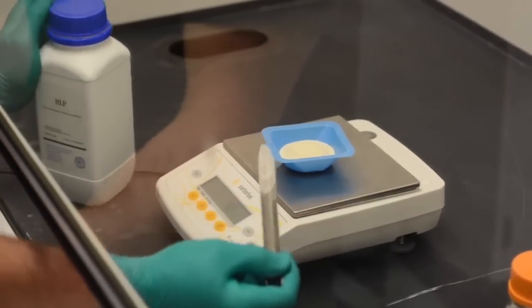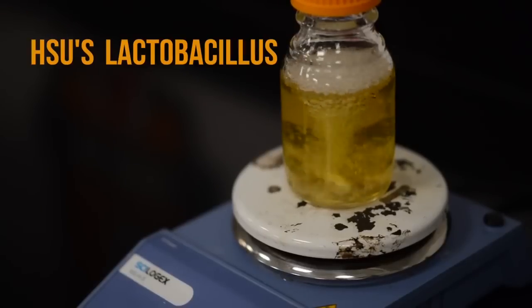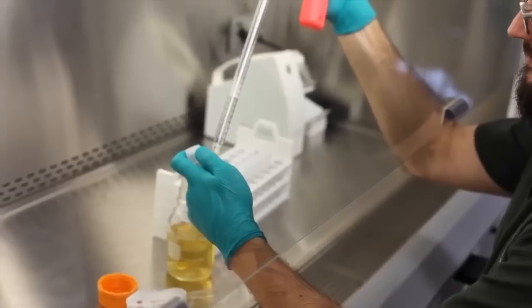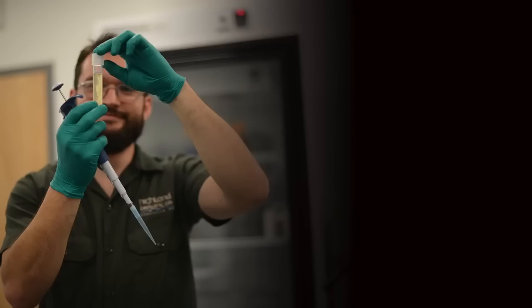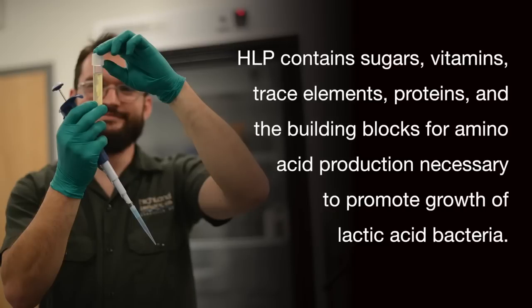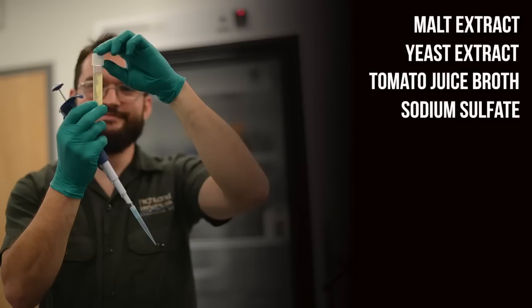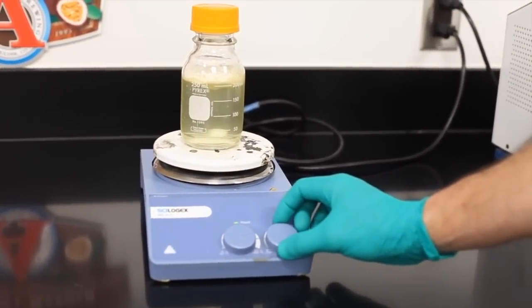Today we'll be talking about one of the more common medias used in the United States for this purpose, called HLP. HLP stands for Hsu's, Lactobacillus, and Pediococcus media. This is a type of selective media, which means that it selects for the bacterial species Lactobacillus and Pediococcus and selects against all others. So here's how it works. HLP contains sugars, vitamins, trace elements, proteins, and the building blocks for amino acid production necessary to promote growth of lactic acid bacteria. Malt extract, yeast extract, tomato juice broth, sodium sulfate for cysteine and methionine production, and vitamin B5 fulfill these nutritional requirements. In addition, several active ingredients select for organisms of interest.